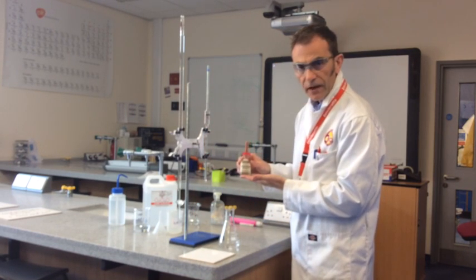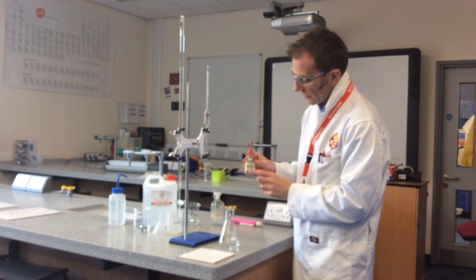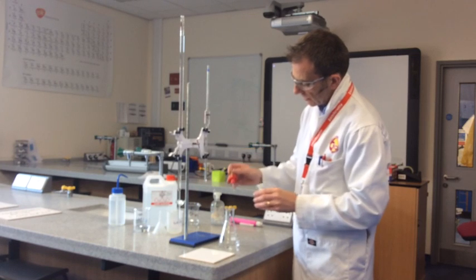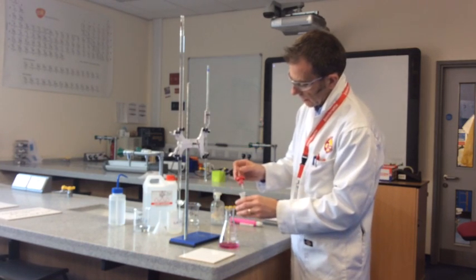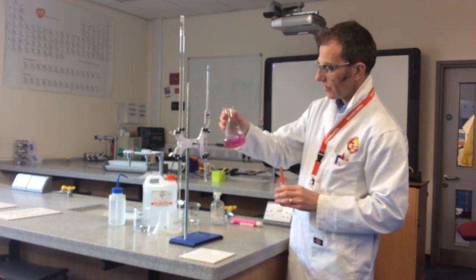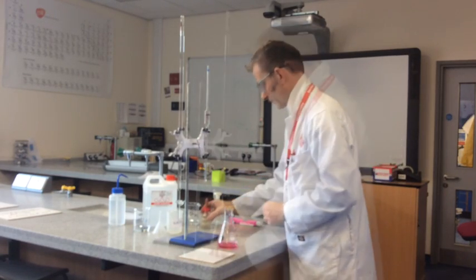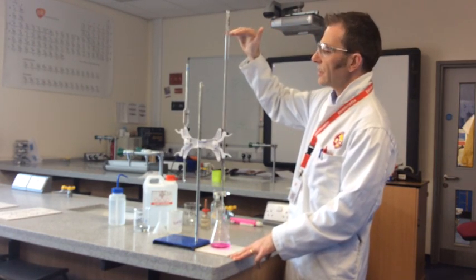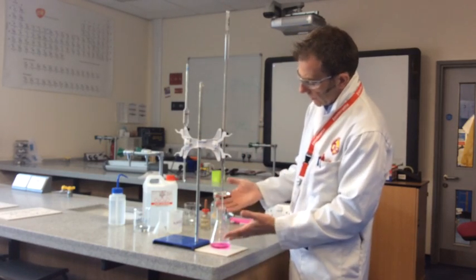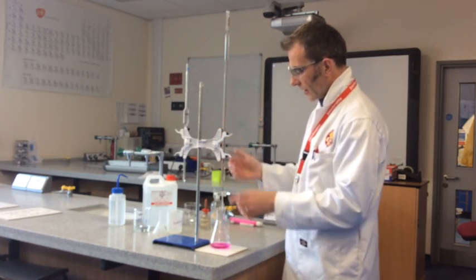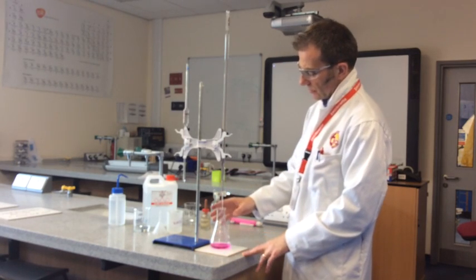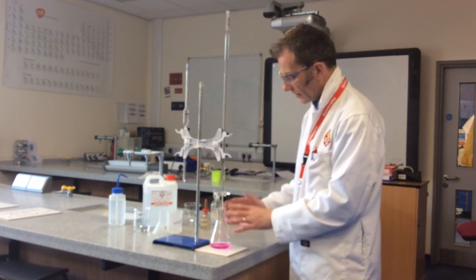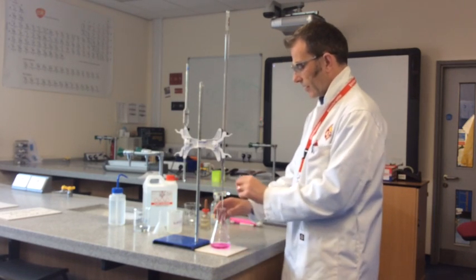Indicator time. Remember, this is phenolphthalein. I'm going to add about five drops of this to the flask. And this is going to help us to know when the reaction is finished. And you can see it's got a nice bright pink color. So we're ready to do our first titration. It's the trial titration. The meniscus is exactly on zero. We've recorded it in our table. We've got the burette at a nice comfortable level for our height. And we're ready to go. So see the jet there of the burette about a centimeter, a couple of centimeters in.